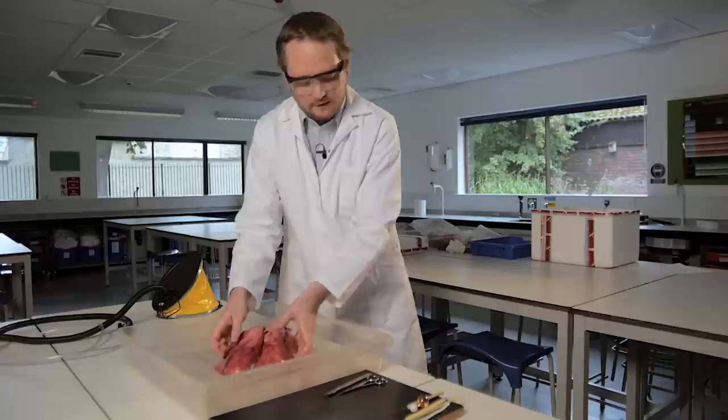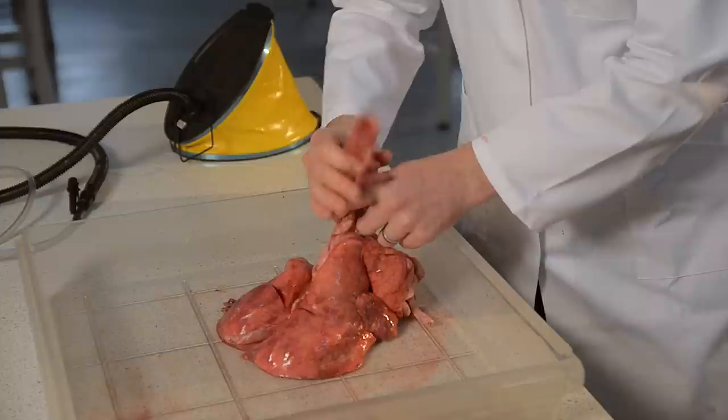This is a lamb's pluck. We're going to use it as a demonstration for a class to teach the structure and function of the breathing system in mammals.